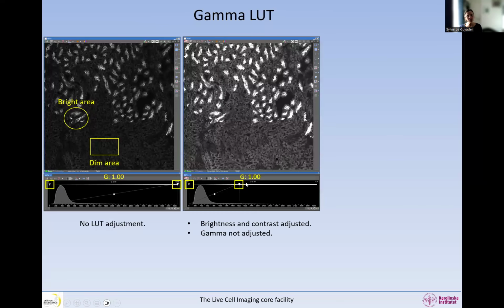So what we could do is push the brightness and contrast, but if you push that, what happens is that now you can see the details in the dim areas, but the brightest areas look saturated. They were not quite saturated, but they look saturated. We see these solid white areas in here. So that's not a very good way to do it. And in this case, the gamma is not adjusted, only the brightness and contrast.